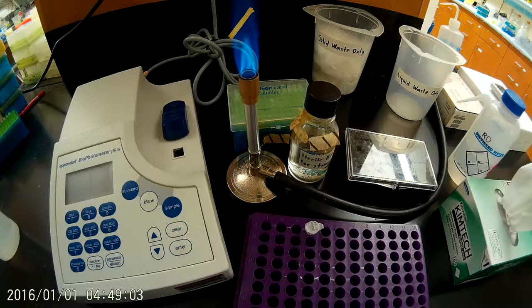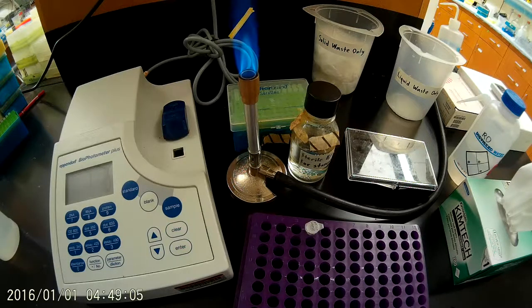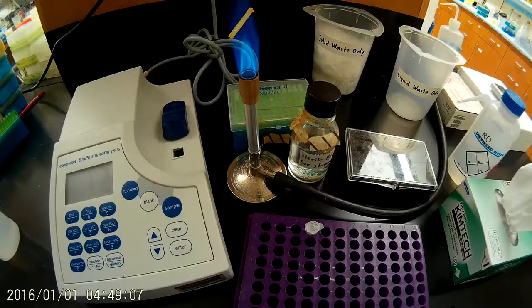Hello everyone, today we're going to be learning how to measure the concentration and purity of a plasmid DNA sample like you would get from a mini prep.